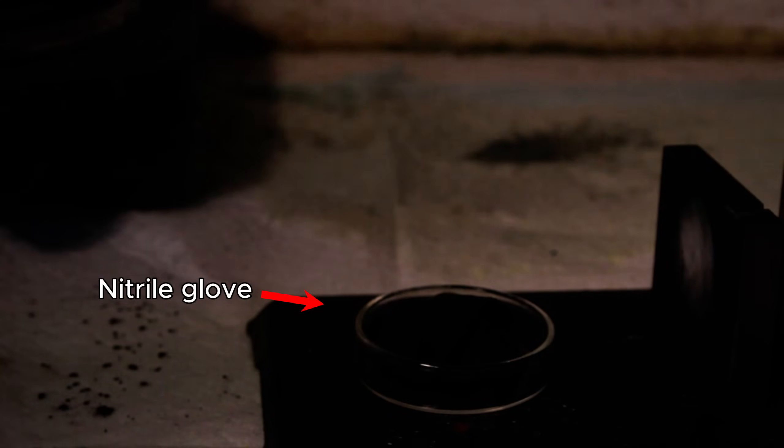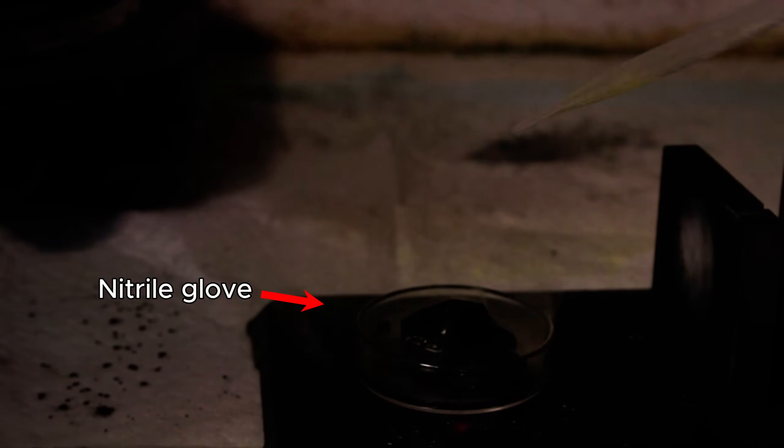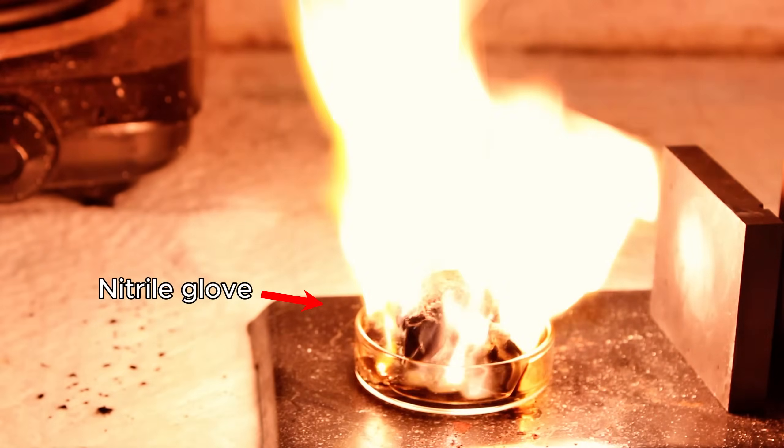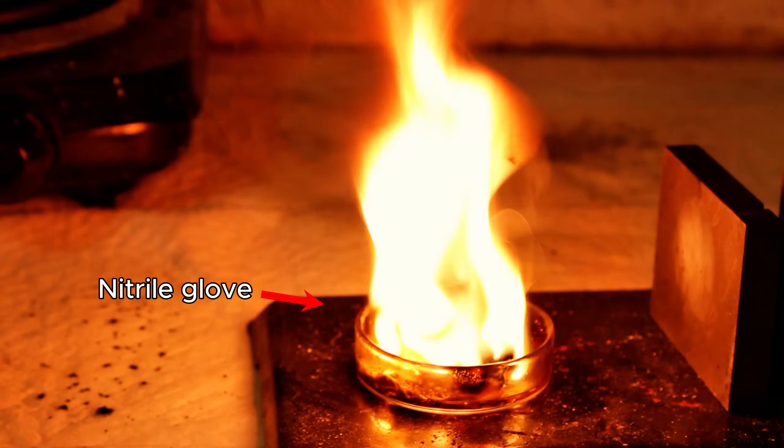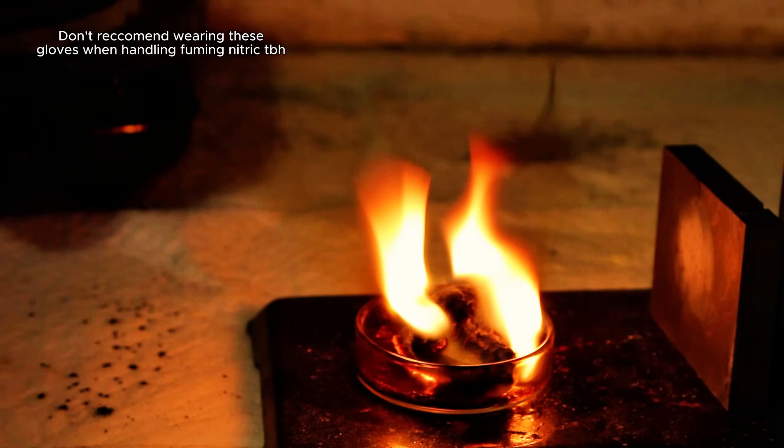Specifically, fuming nitric acid will react aggressively with many materials including nitrile, which most lab gloves are made of. In fact, the reaction between fuming nitric acid and nitrile is so aggressive I almost never wear nitrile gloves when handling the stuff.